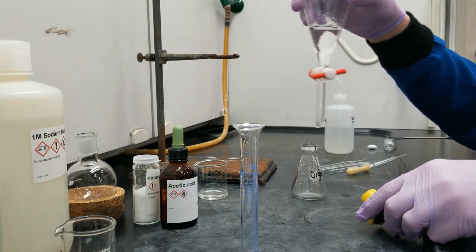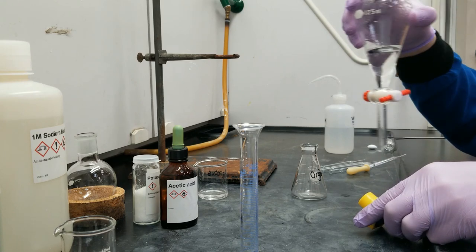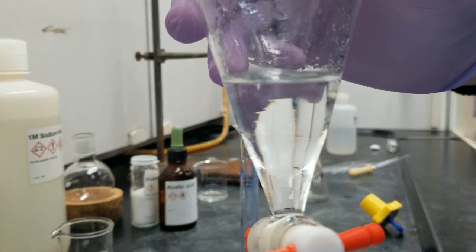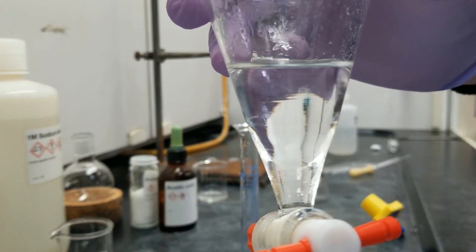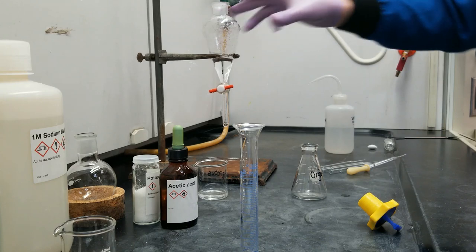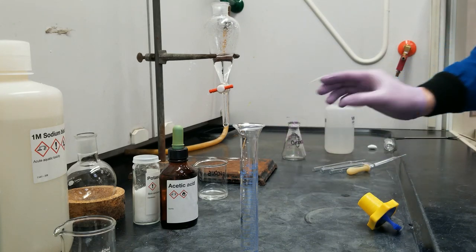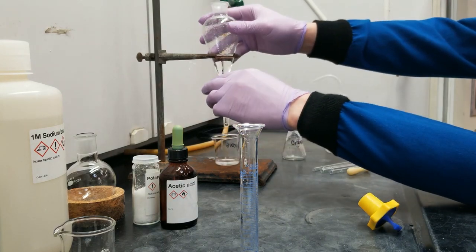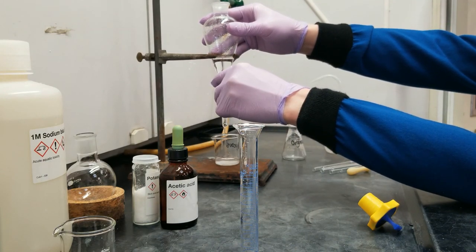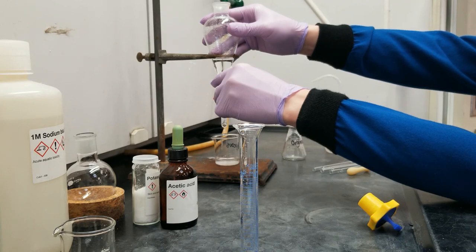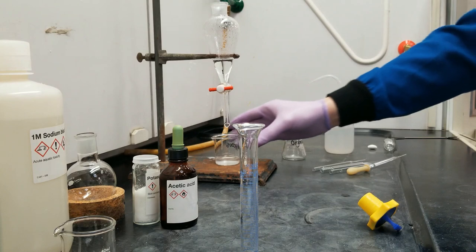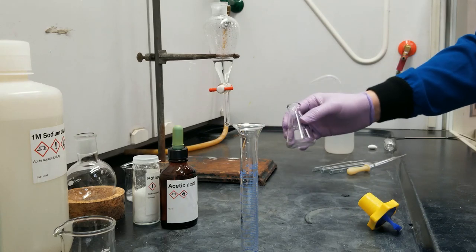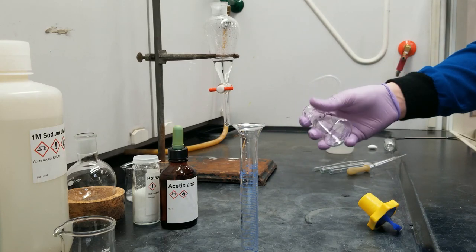Now, do I have a nice, clean layer here? Oh, this is a sneaky layer. It is nearly invisible. Let's see if I can get it. Yeah, that's a tricky one, but we can see it, so we can extract. And I'm just going to let the brine fall into this aqueous layer again. And I'm going to do the exact same thing again, where I'm going to let a little bit of the organic layer through. Just a drop or two, just to make sure I don't get any water in the organic layer. And yeah, I am just going to use this flask again.